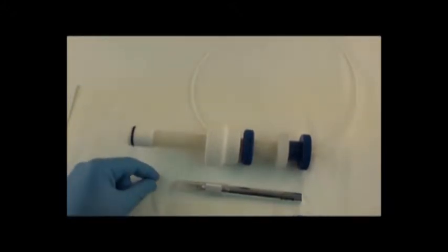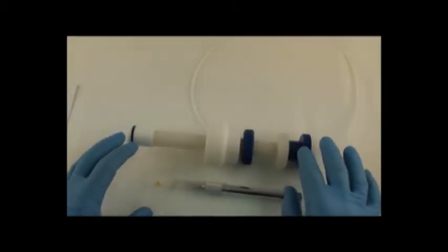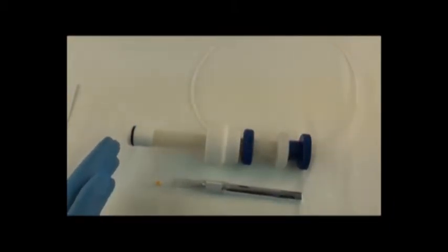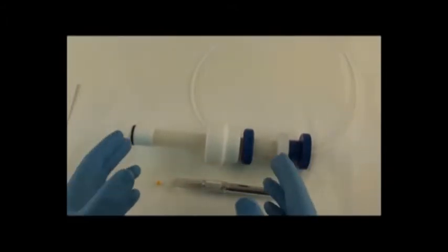What you need for this process is a razor knife or exacto knife, a replacement ferrule, and what we're going to do is disassemble the flow adapter, cut the tubing, put the new ferrule on and then reassemble it.